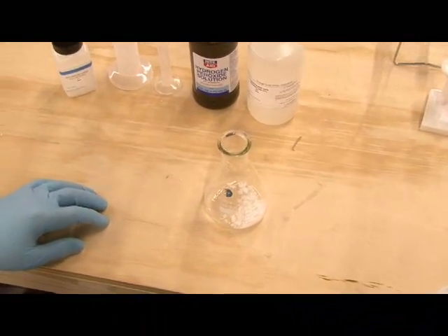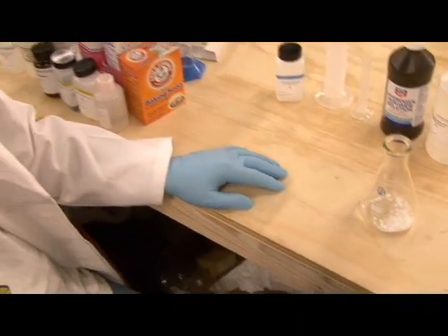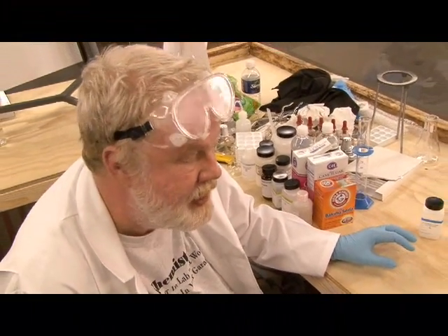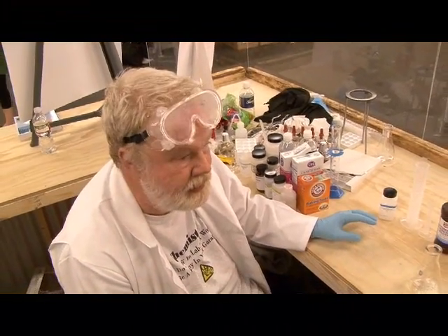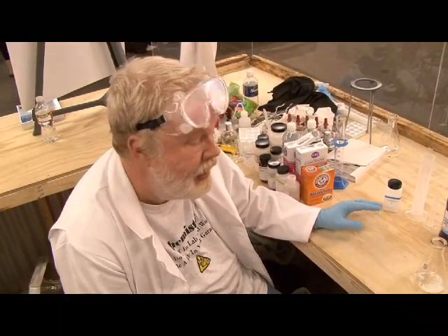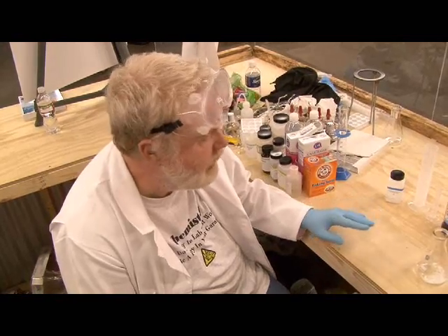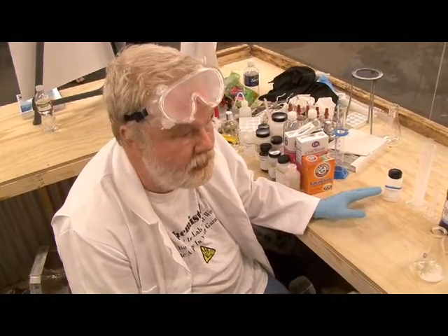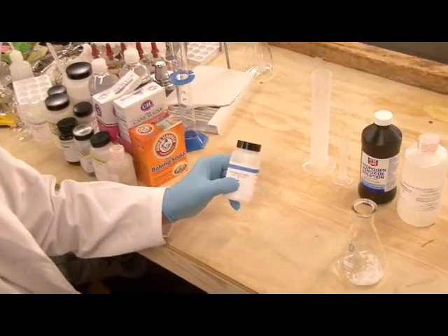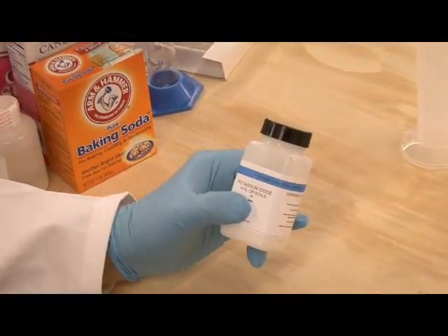It's a common laboratory chemical. Also, interestingly, anywhere near a nuclear plant they have stocks of this stuff in pill form, because if there is a nuclear accident and iodine-131 — which has a partiality for accumulating in your thyroid — is released, what they do is give everybody, adults and children, a dose of this twice a day. The label on this chemical is blue, which means poison. It's about as poisonous as table salt.